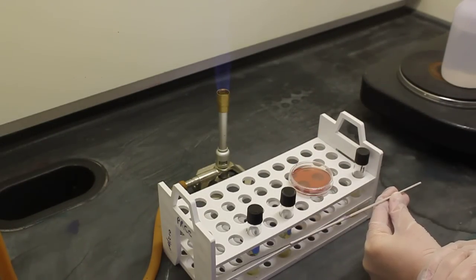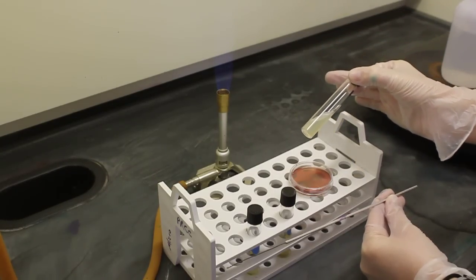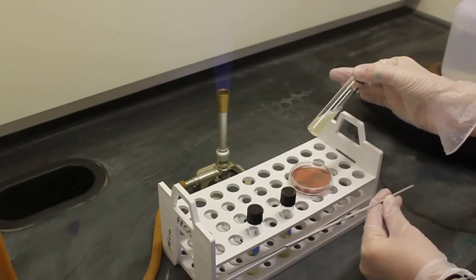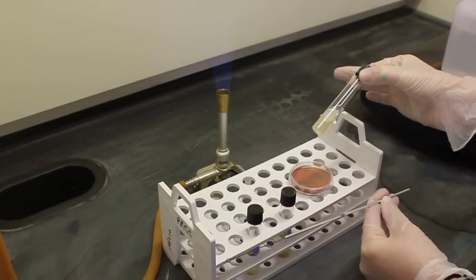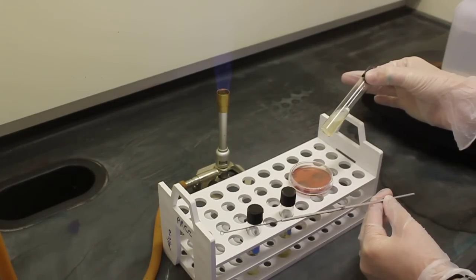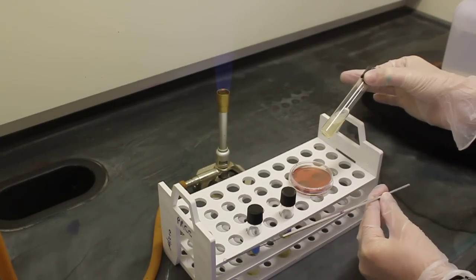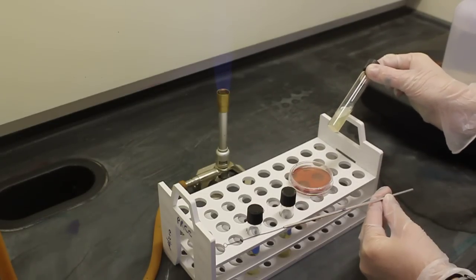I'm now going to demonstrate how to inoculate all three types of media using the same stock culture. The stock culture is the initial bacteria you use from which all the bacteria comes for your subsequent inoculations. The word inoculate simply means to take bacteria from this stock culture and place it into a sterile media.